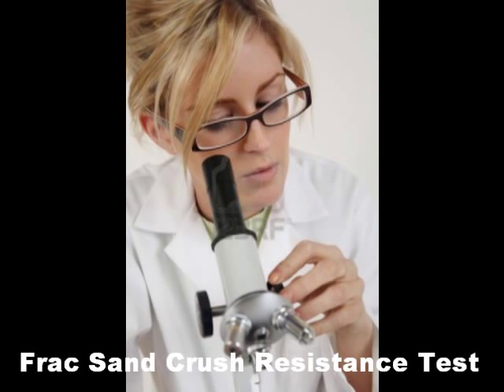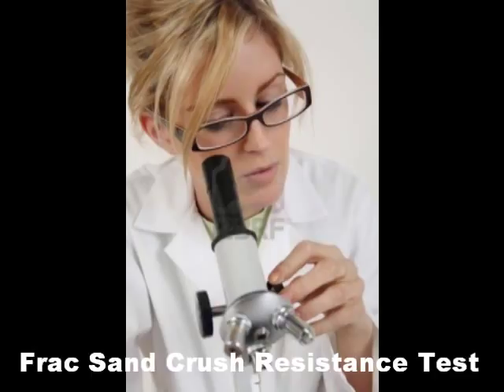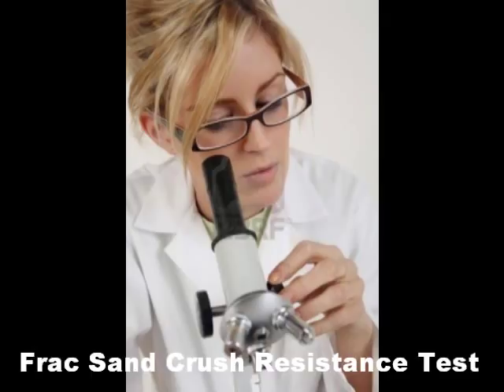Brandon Nishah here, lab director, Global Energy Labs. How are you guys doing? Do you have frac sand? One of the tests to determine whether or not you do is the crush resistance test.